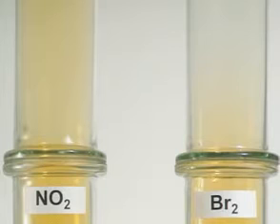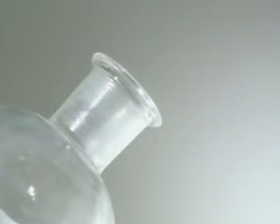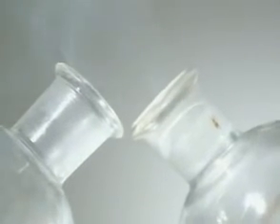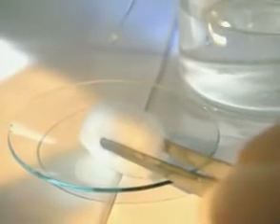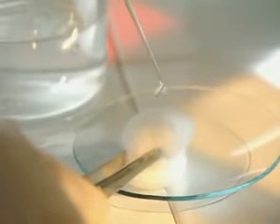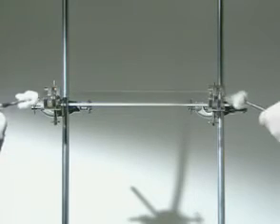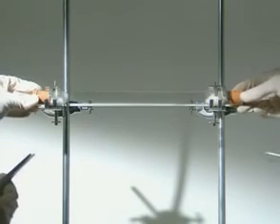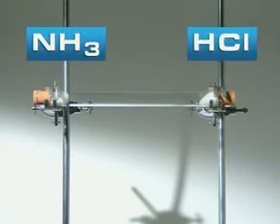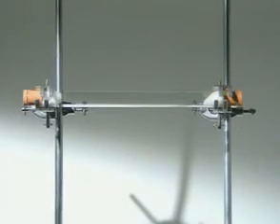We can also compare the diffusion rates of other gases. Ammonia and hydrogen chloride gas are colourless, but when they meet, a white cloud of ammonium chloride forms. A piece of cotton wool soaked in concentrated ammonia solution provides ammonia gas, and concentrated hydrochloric acid provides hydrogen chloride gas. Place the two pieces of cotton wool at opposite ends of a tube and the gases spread out.